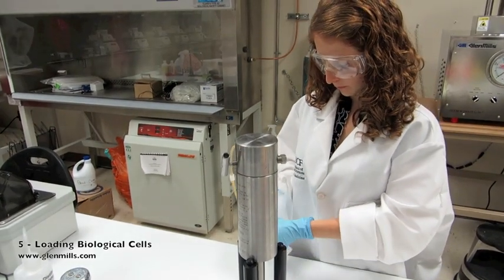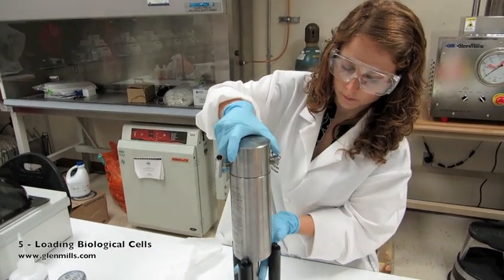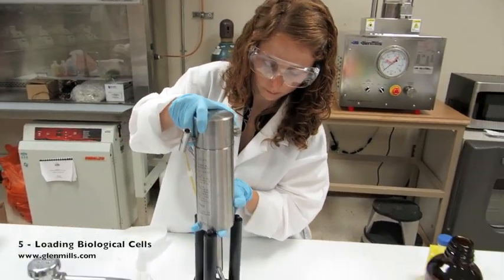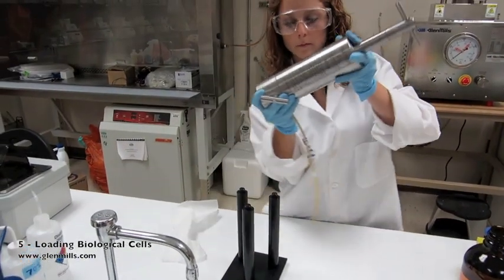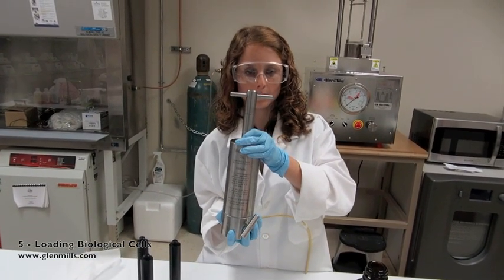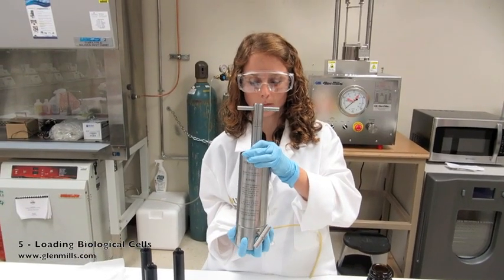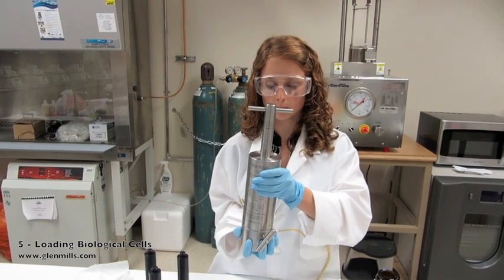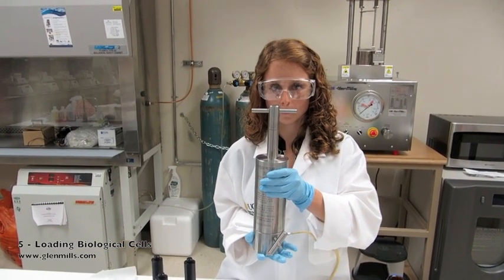Invert all these parts as a set. Be sure the closure plug does not fall out. When fully assembled, this equipment is a bit heavy, about 20 pounds or 9 kilograms. So hold it securely at the bottom so that the closure plug does not drop off.